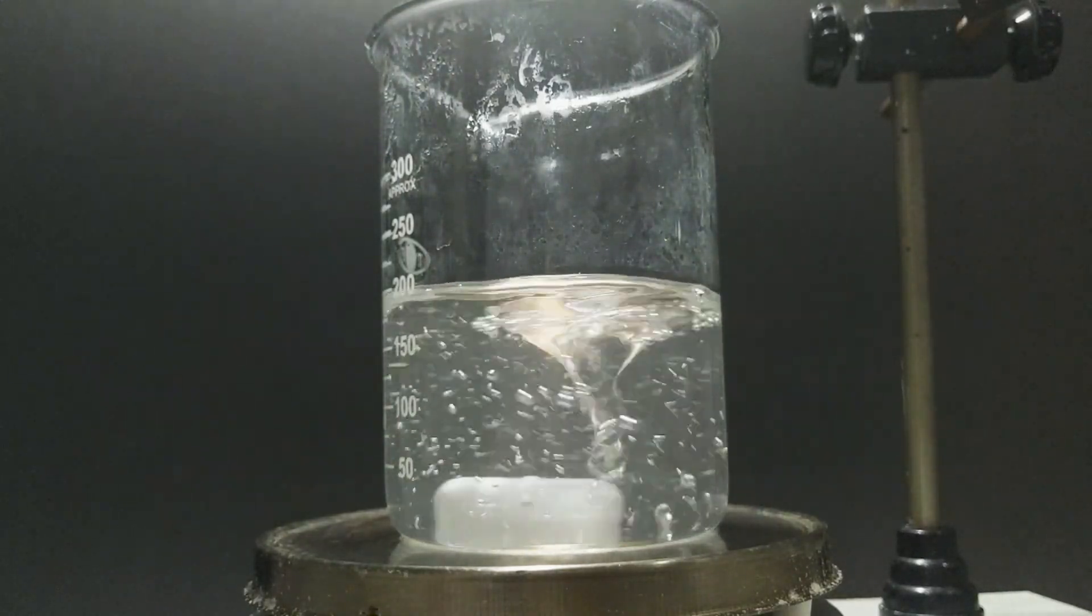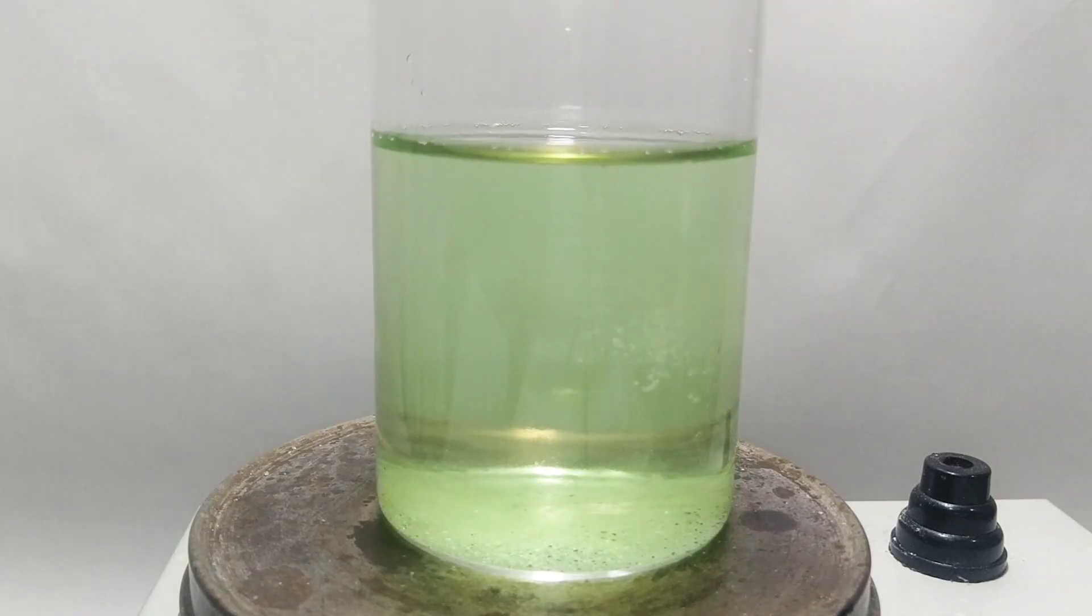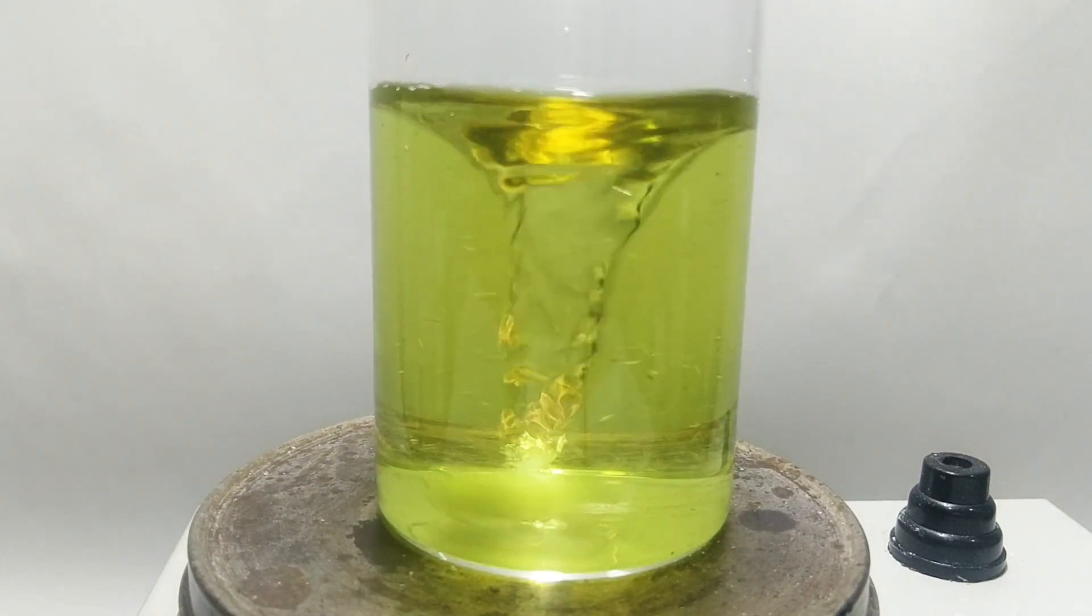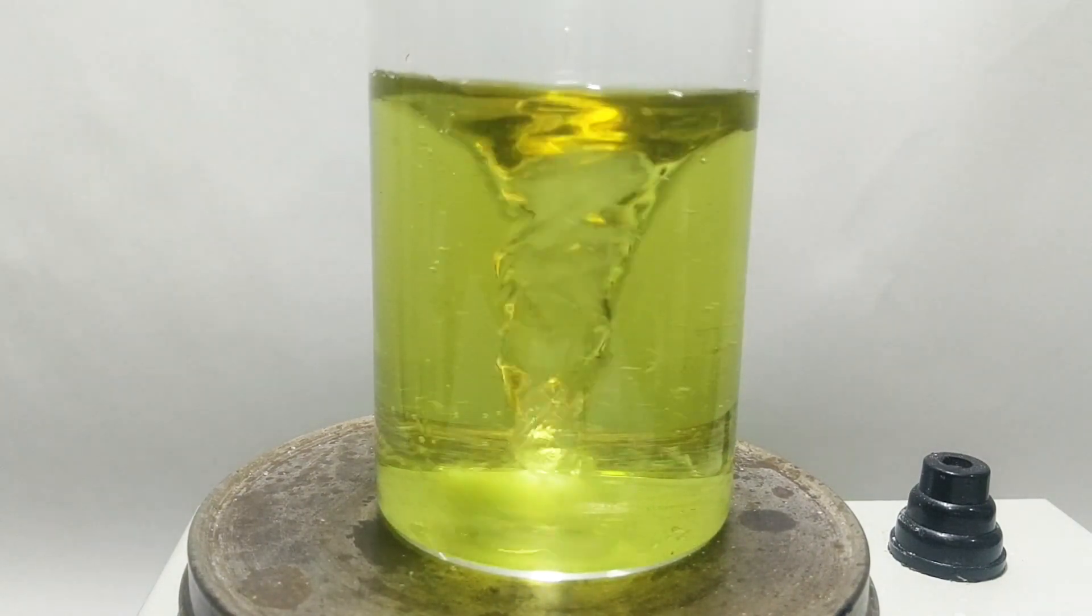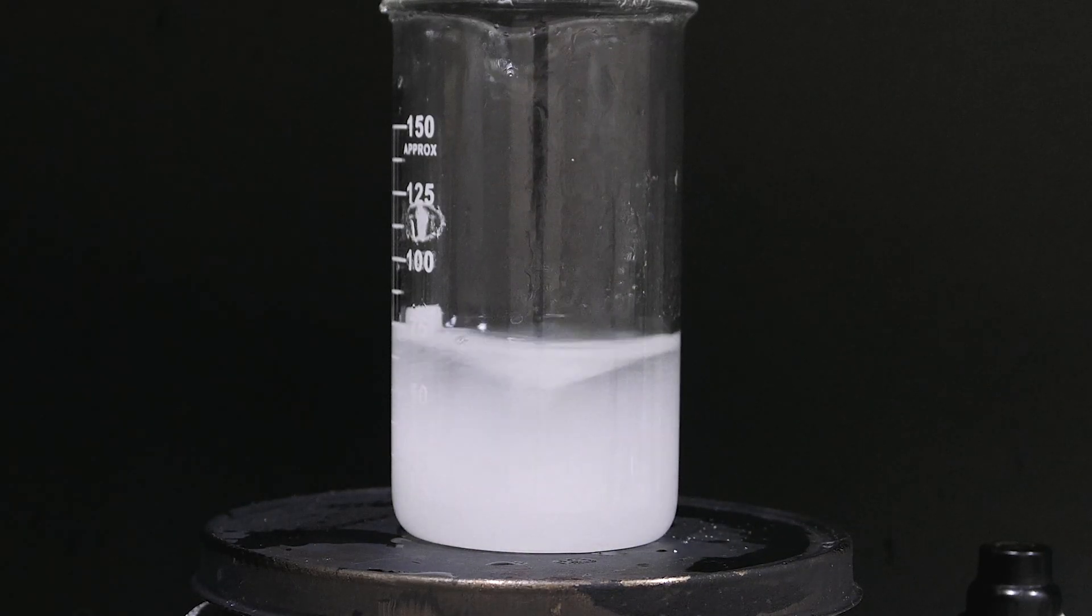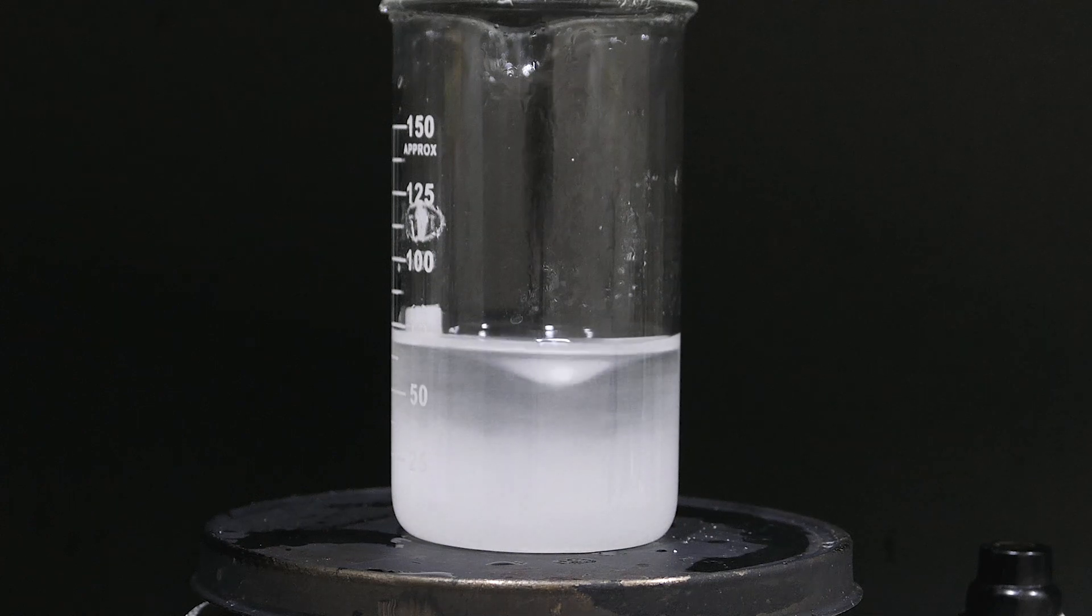Let's measure 40g of sodium persulfate. Persulfate anion is a strong oxidizer, which can easily oxidize iron 2+ to iron 3+. This substance can be found in an electronics store for etching copper circuit boards. 30g of sodium persulfate was added into bismuth nitrate solution.